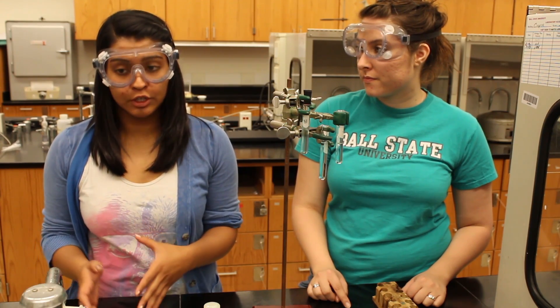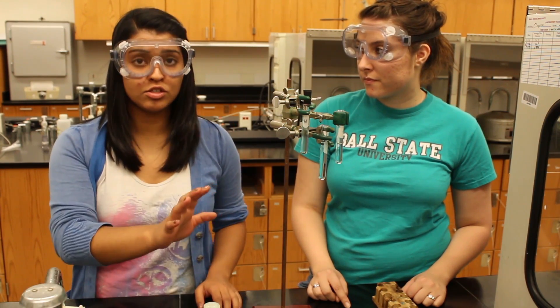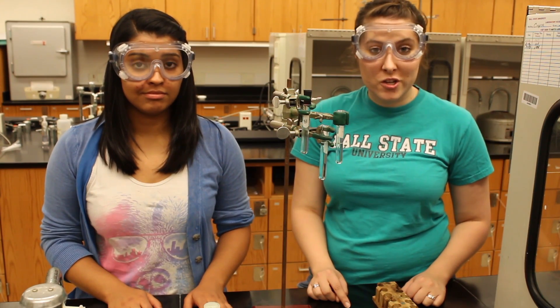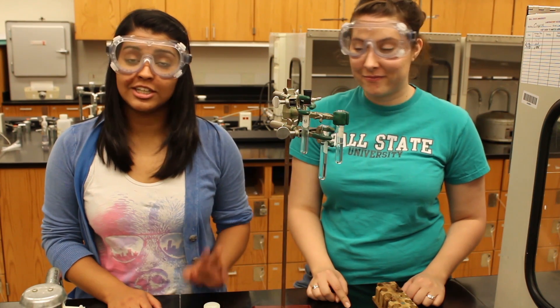After you make all of your observations and recordings in your lab book, make sure you discard all the solutions in the proper waste containers, then wash all your glassware and put it away. Make sure you wash your hands before you leave lab today. Good luck!